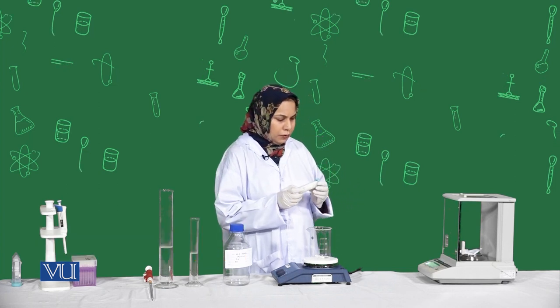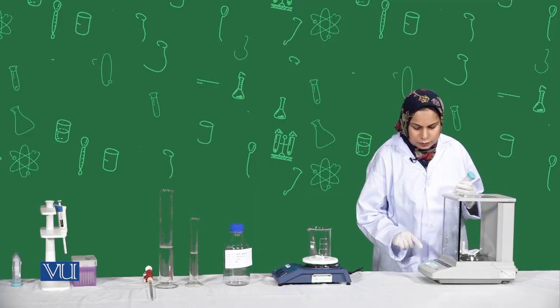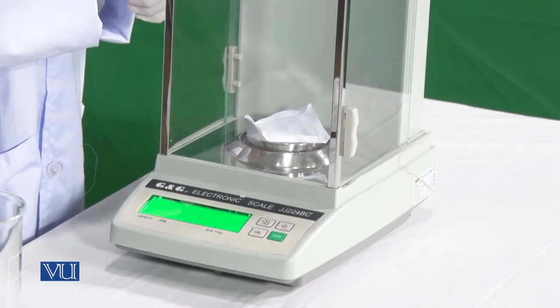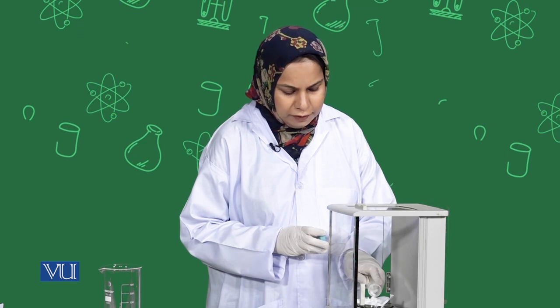Students, the next solution is 10 normal NaOH solution. NaOH is a base and usually found in the form of pellets. First we are going to weigh our NaOH pellets — we need 40 grams of NaOH to make 100 ml of the solution. Tare or zero the weighing paper, then when the reading is zero, add pellets to reach 40 grams. NaOH is highly basic, so you should be careful while handling its pellets. We will be needing distilled water — I am taking about 65 ml of distilled water, because when we add the NaOH pellets, their weight will add up.